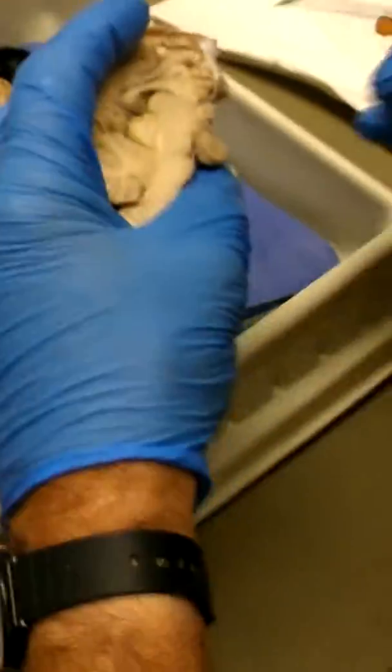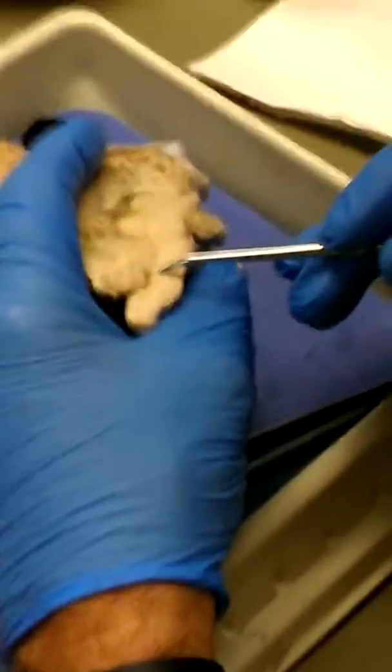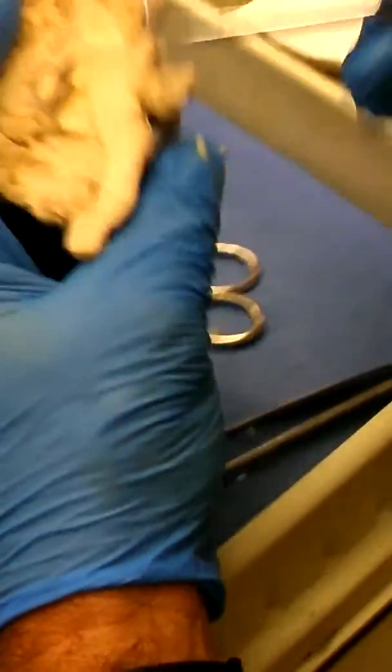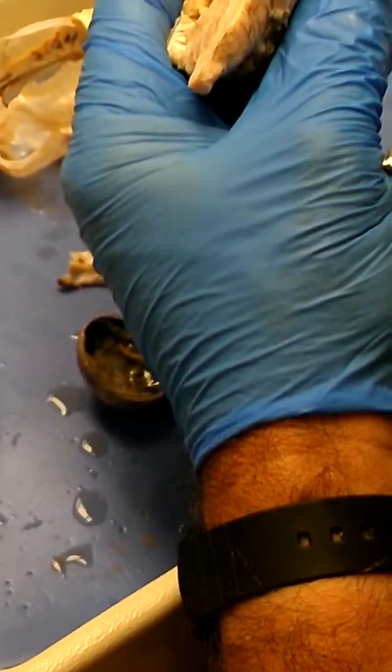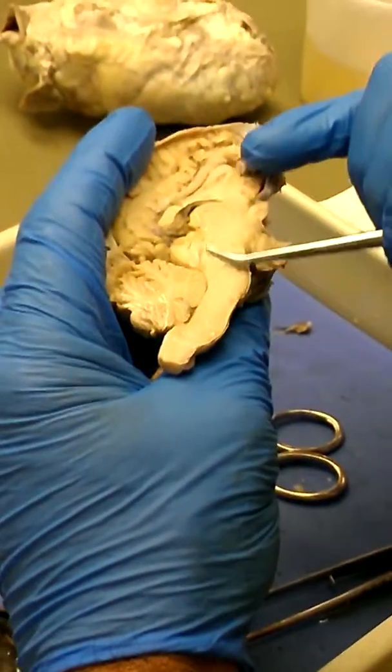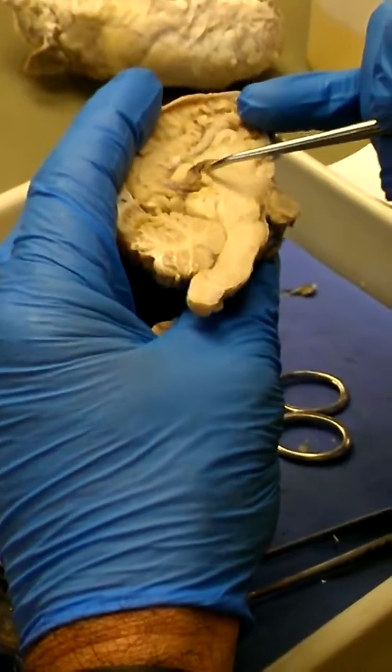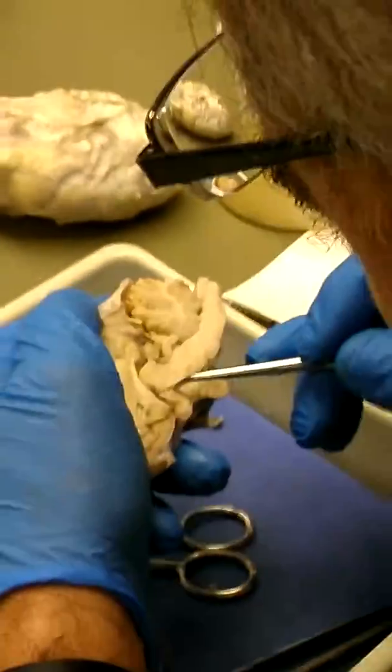All right. Now, other things you need to know. So, this was the pons, and this was the medulla, right? The pons and the medulla. How can you separate? Because I know it from that bridge. Oh, okay. That's the pons. Can't tell it from the inside. Okay. Now I come forward up here, and I've got some midbrain structure sticking up to right about here. Then I have a big round structure. It may be better on this side. Yeah, it is. Okay. I've got a really clear, big round structure right here.